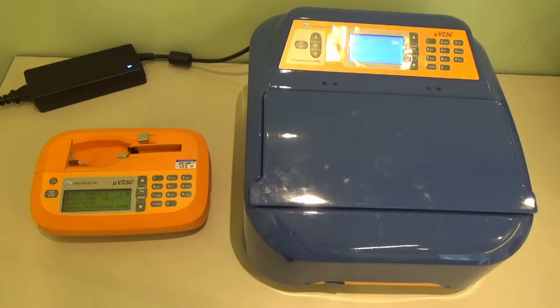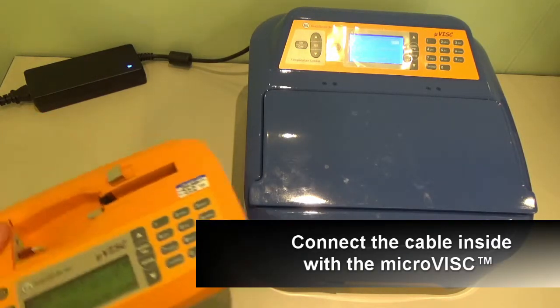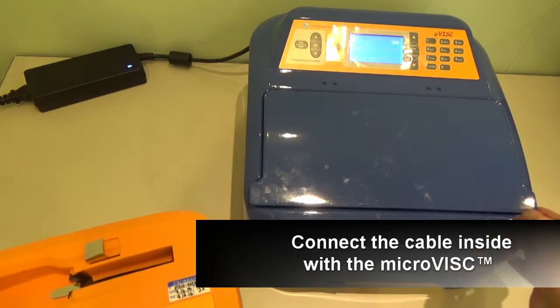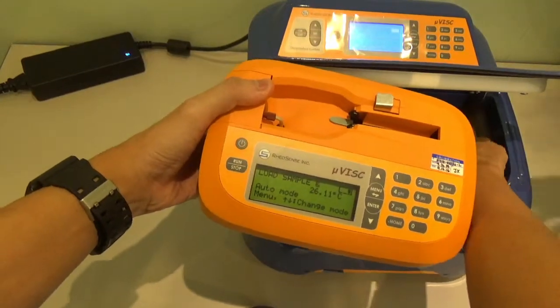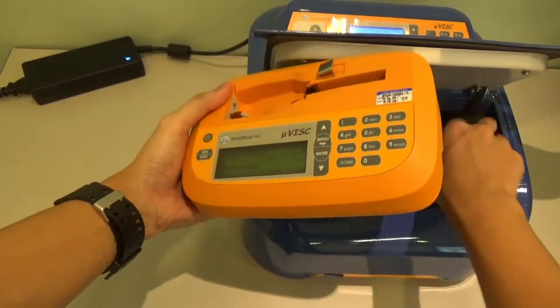First of all, you need to connect the microVISC to this temperature controller. You just need to connect the cable over here.